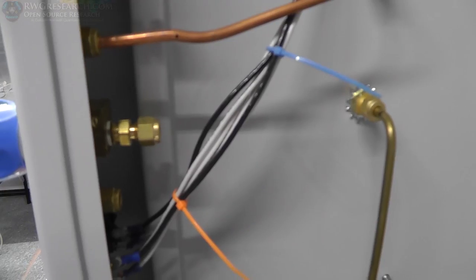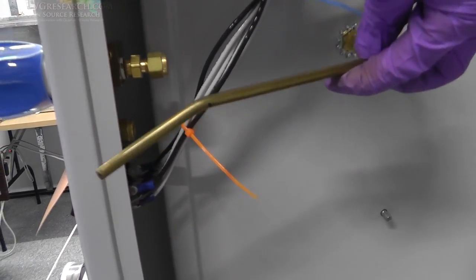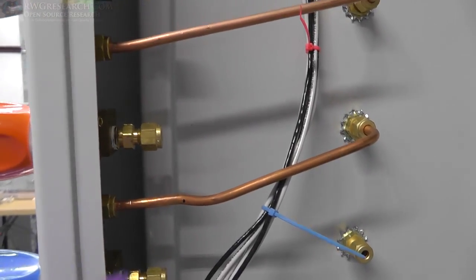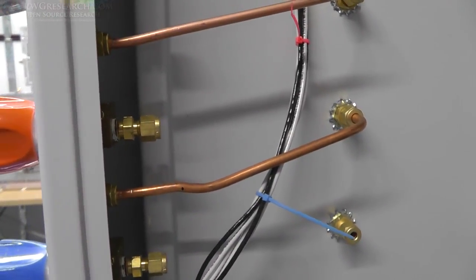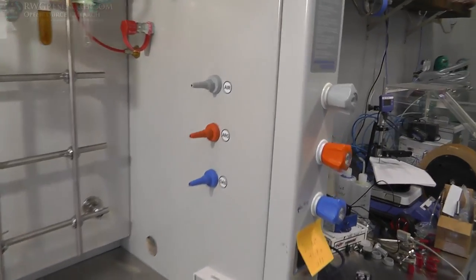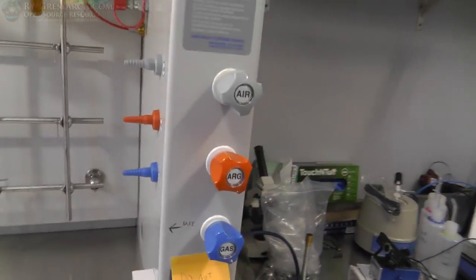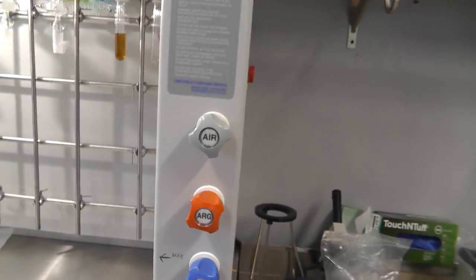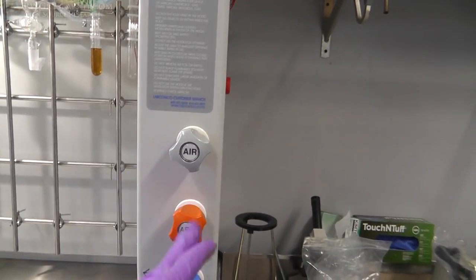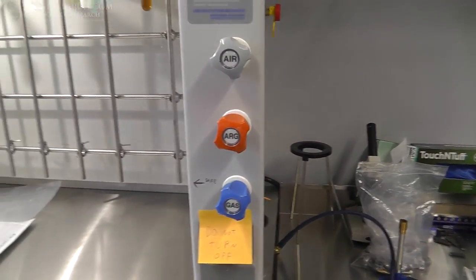Let's get it done. Well, apparently they did this one the same way. Bent the wrong way, so we'll fix it. It does not look nice, but it's functional. That's what matters. Professional. Check it out. Nice. So we got argon, gas, and air. And then we can change this one if I don't want air. I originally have nitrogen and argon, but I think we're only going to use argon, most likely. So anyway, and then the gas.